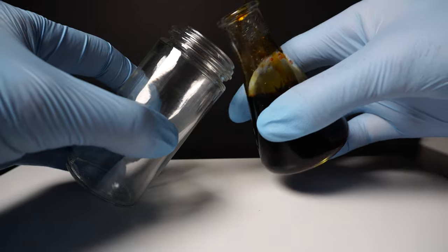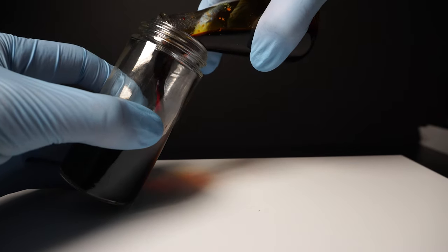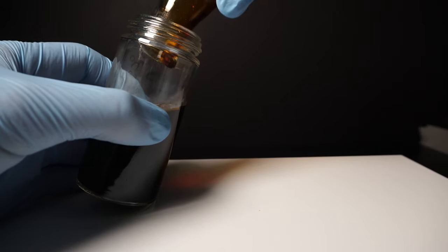Once it looks like no more will be dissolved, I empty the flask into a jar. And just to see how much this stains, I show my gloves after I poured it.